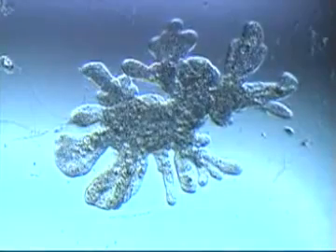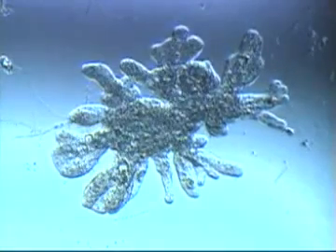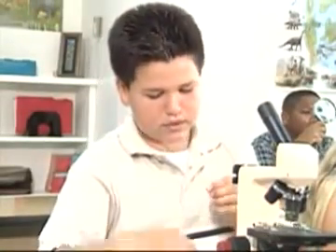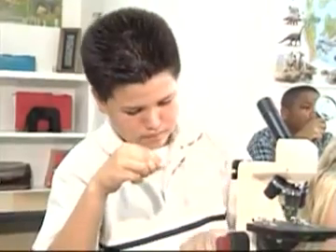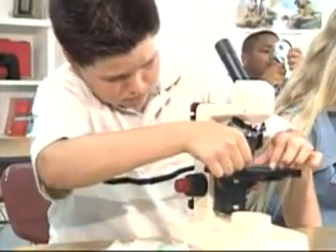The organisms you see in a drop of pond water may look strange, but they share much in common with you and me. Here's how you can prove it. Scrape the inside of your cheek with a toothpick. Dab this on a glass slide and cover it with a cover slip. Then place this under your microscope.